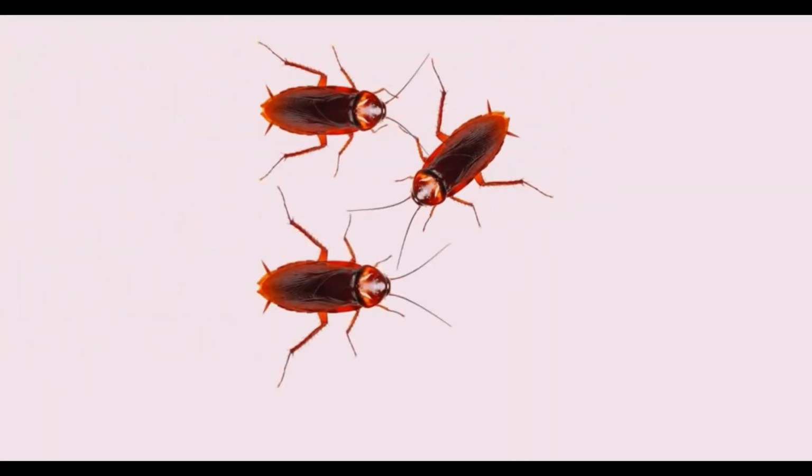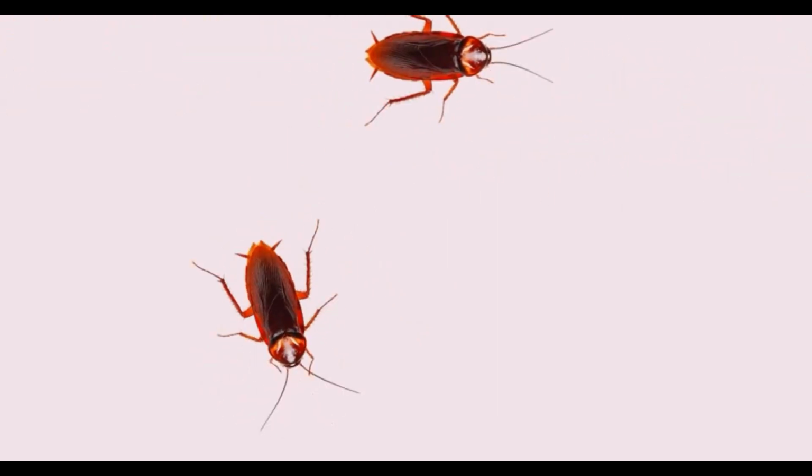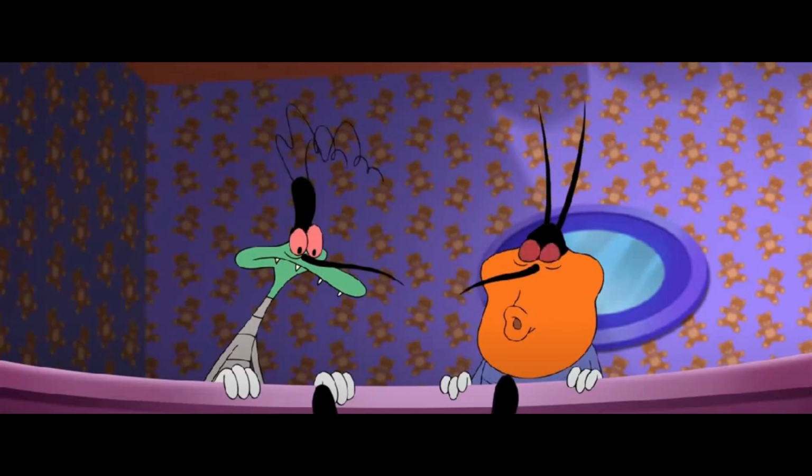Just like humans, the digestive system of this insect is essential to them, comprising a basic structure that helps them ingest food and extract the nutrients they need to survive.